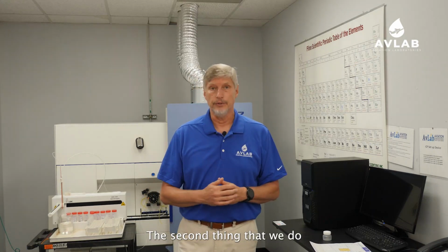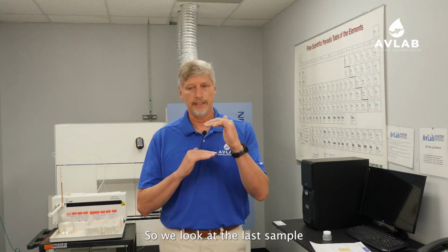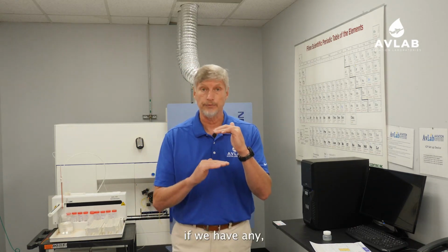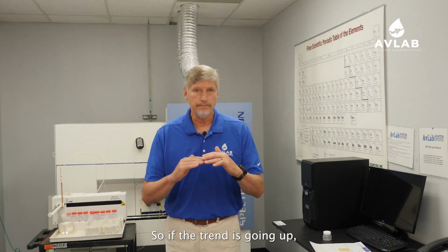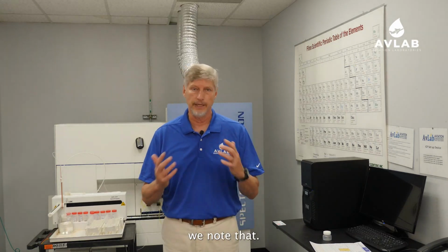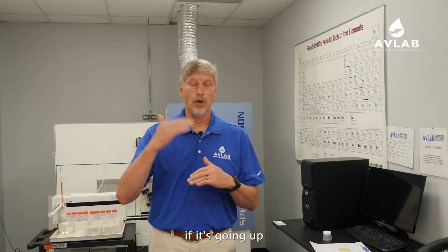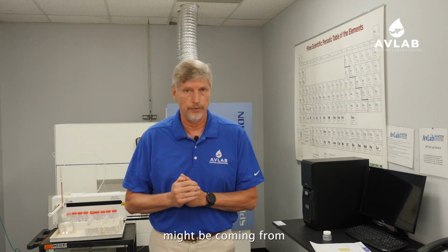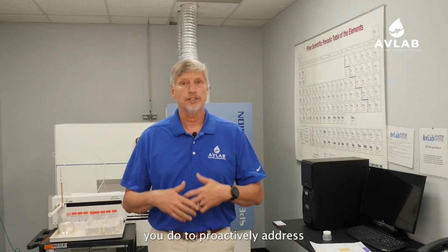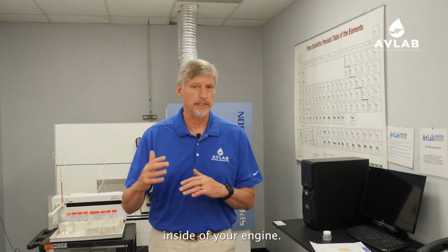The second thing that we do is the much more important part of that, and that's to compare the trend that you're doing. So we look at the last sample or the last several samples, if we have any, and we compare that to the new sample. So if the trend is going up, we note that. If it's going down, we note that. If it's staying consistently the same, that's a good thing. We also note that. And we comment on that. If it's going up, exceptionally up, we'll make a comment about where we think that metal might be coming from and what we suggest you do to proactively address what looks like a growing problem inside of your engine.